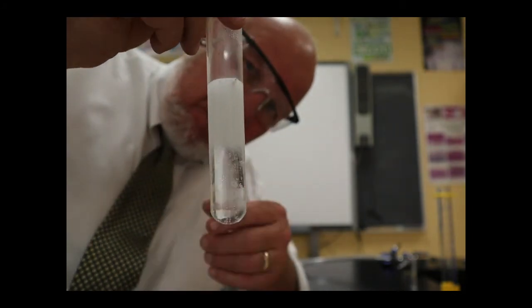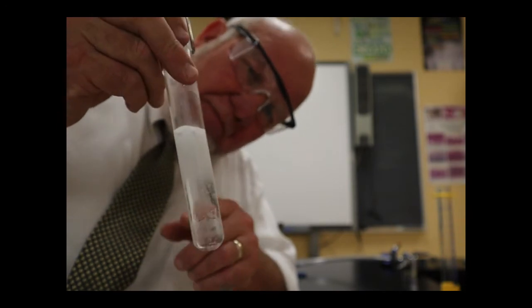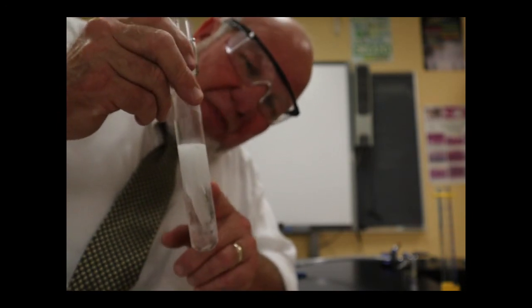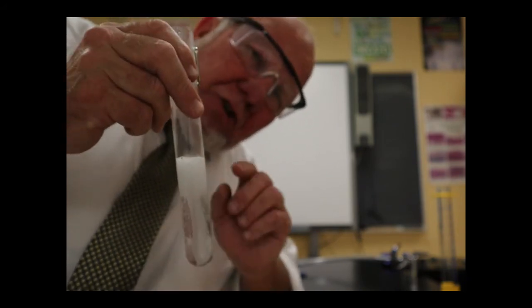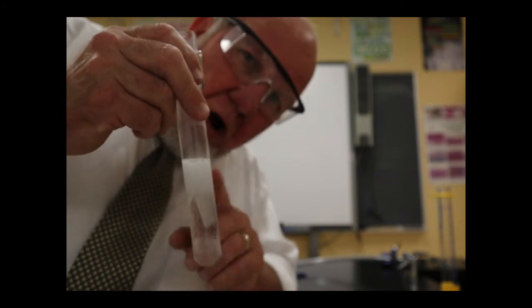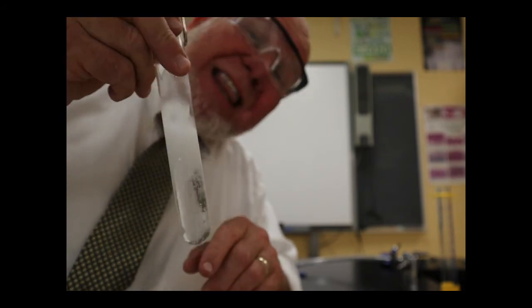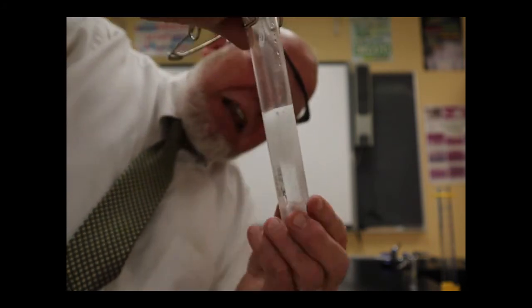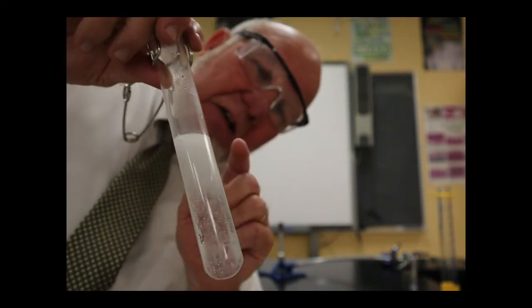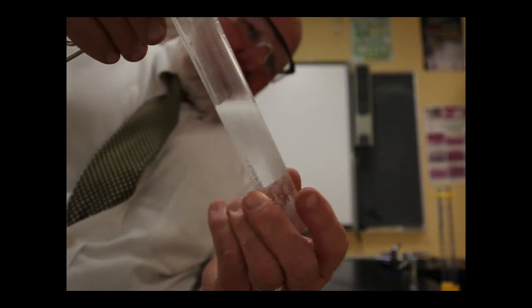So, lesson one, when you're doing an experiment for the first time, you make notes about things like, this is taking a lot longer than I'd like. So what I want to do, if I were going to do this again, and I probably will, is use a more concentrated acid that's stronger, that will react much faster with the magnesium, so that I don't have to wait as long. I mean, it's been almost 10 minutes, and we still haven't got it reacted, and we've got to wait and evaporate off that liquid. And that's going to take about 10 to 15 minutes.